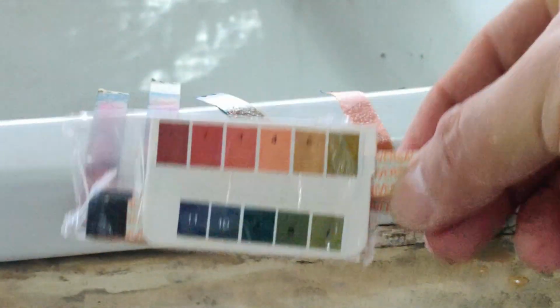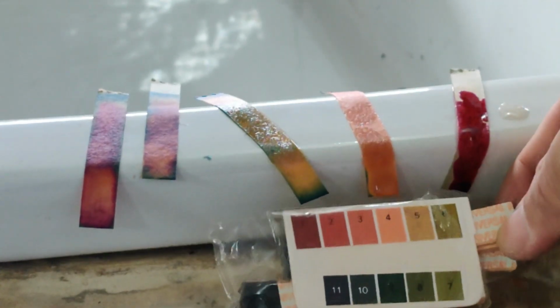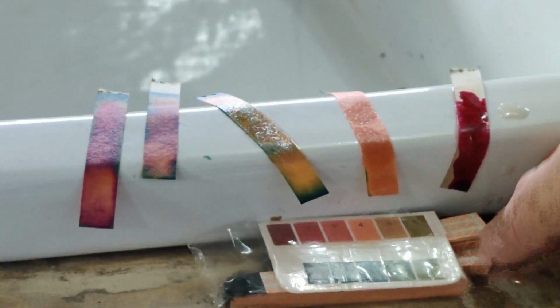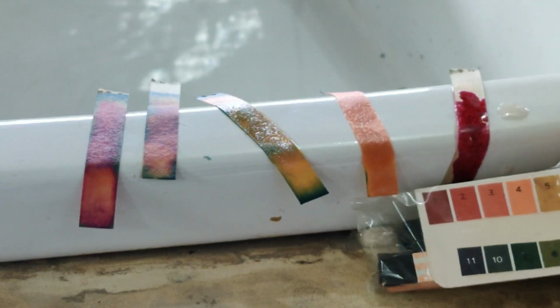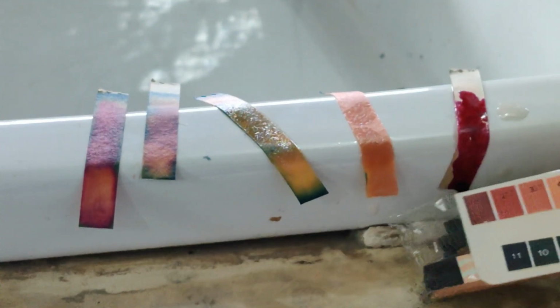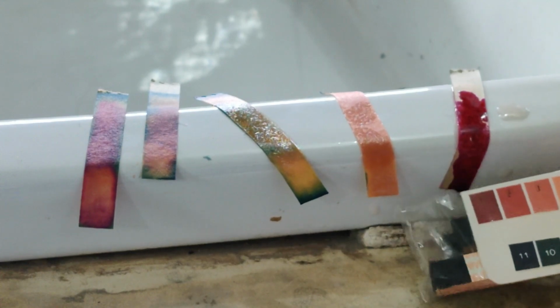So again I am repeating, you have to match the color with this paper. As you match whichever color it is matching with, for example if I want to match here, I think this is what it is matching, you see number 4, and this paper, this one I am talking about, just look at that 4, and if you look at this one, then I think it is matching 2. So I think the strongest acid I had used was your concentrated sulfuric acid. Concentrated sulfuric acid, look at this. So this is matching more or less this one. So 1, pH value is 1, means very strongly acidic.